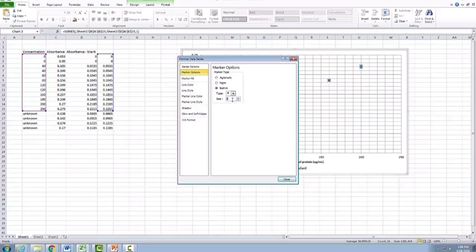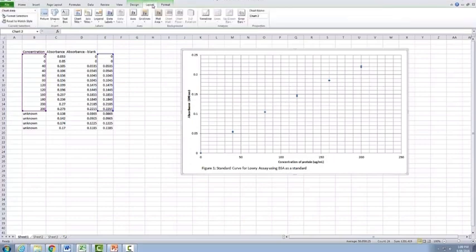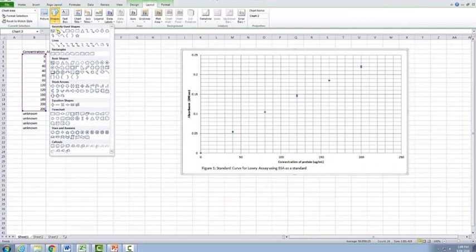In most cases, you can probably drop the size down to 5, but depending on the actual shape, so some of these shapes here tend to be bigger than others, you may need to actually drop this size down to 3 or 4, because we want to make sure that our markers are always clear to see, but not so large that they actually take up a lot of space. So it actually means that our line of best fit will not be very accurate. So now that we have our markers smaller, what we can actually do is go here to Layout, Shapes, and now we're going to add in a line.